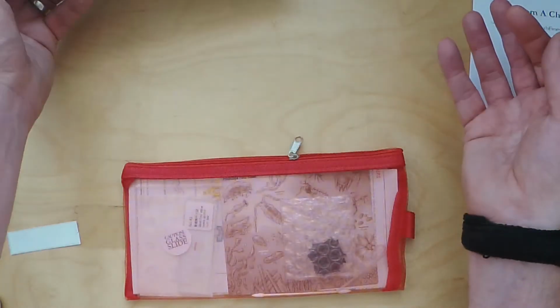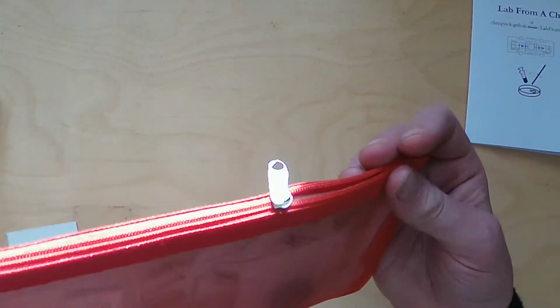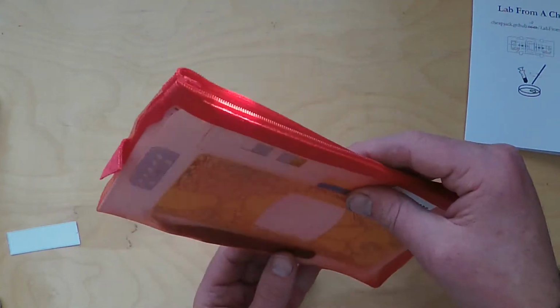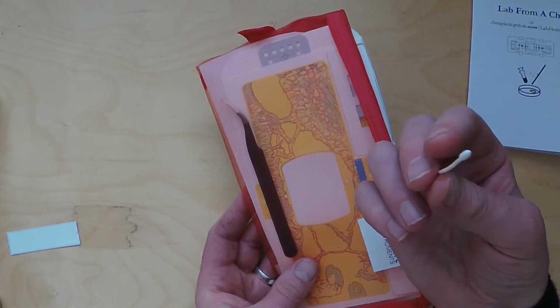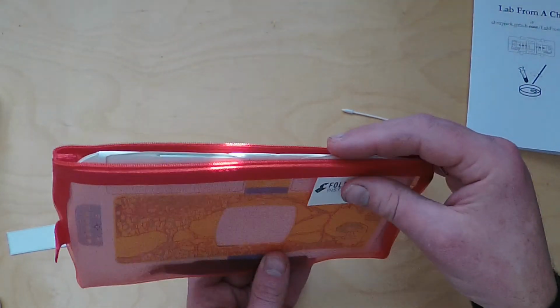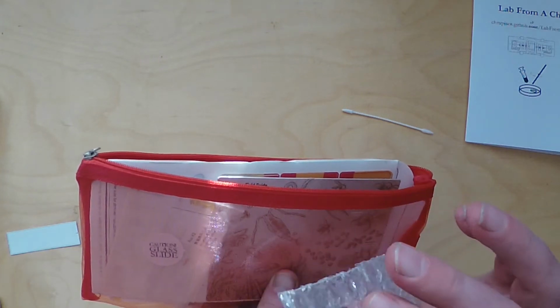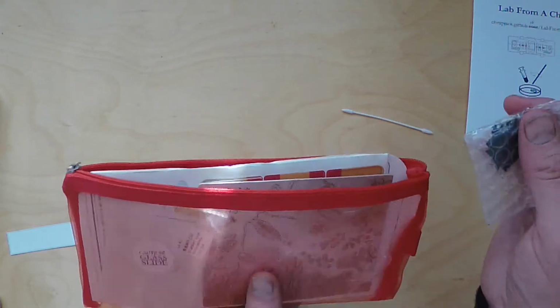So you'll get your Foldscope, a little bag, you can unzip it. Like I said before, there's a pair of tweezers that will be handy for our slide preparation later. There's also a tiny little Q-tip. This is for cleaning the lens, which I'll explain later. Let's put that to one side. There's a tiny bubble wrapped bag, and this is the lens coupler assembly. So this is where your actual ball lens lives, and I'll go through those in a minute.